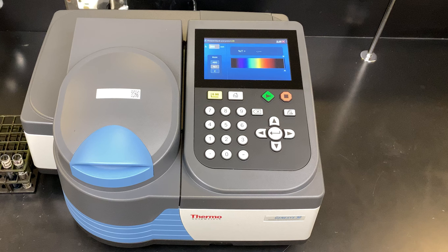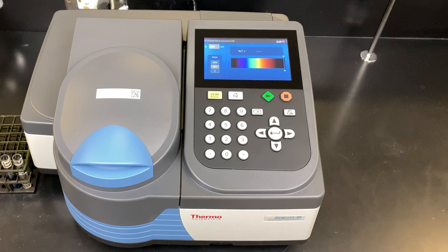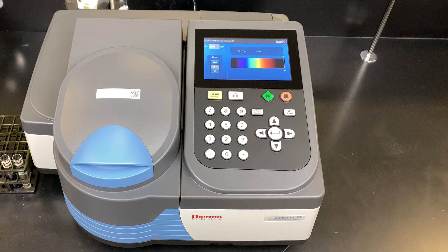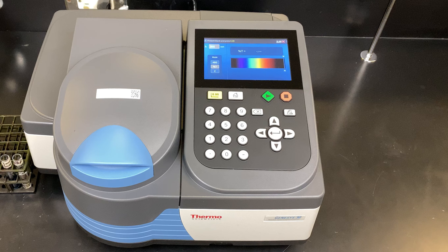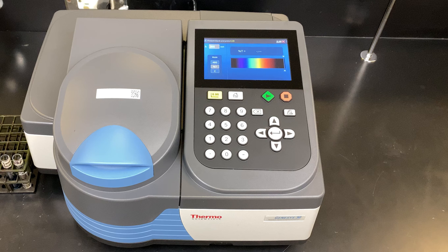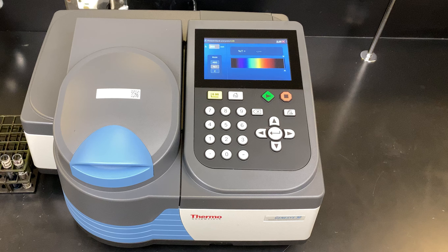The stock concentration is too concentrated for any light to pass through in the spectrophotometer. Today we've diluted it down to 25 milligrams per liter — I found that's a good concentration to get a proper absorption spectrum. The automatic scan feature is a quick way to easily collect data for wavelengths between 325 nanometers up to 1,100 nanometers, and all the data can be offloaded onto a USB stick.